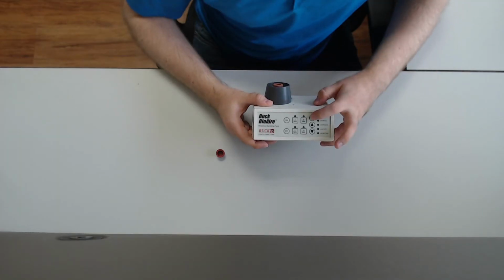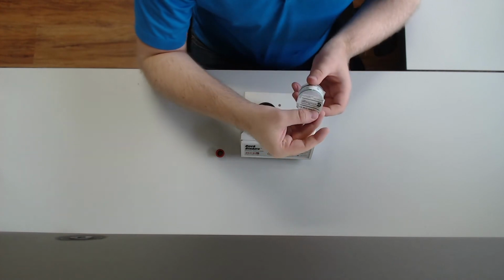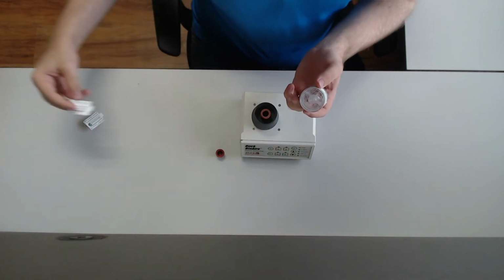Step 2. Press the Cal button to turn on calibration mode. Allow the pump to run for 1 minute to stabilize. You'll be able to tell that the pump has stabilized because the sound of the pump will be consistent. Step 3. Remove the top and bottom quality seals from your samples and put them somewhere safe. You'll need them again when you're done sampling.